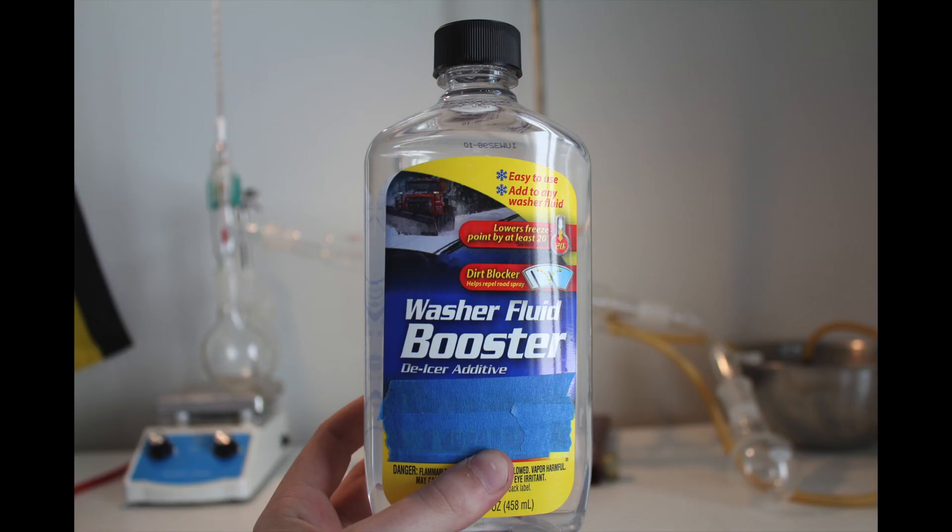First, get some antifreeze booster. This will contain ethylene glycol, methanol, and a little bit of isopropanol.